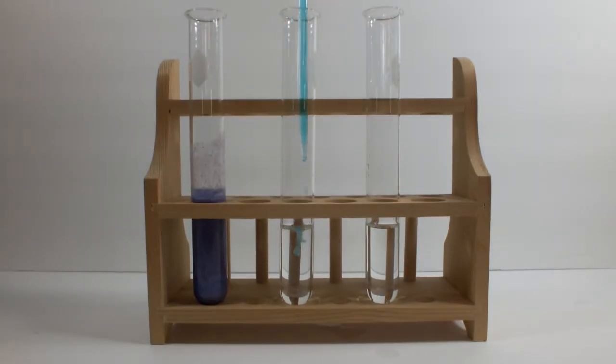Next up is copper 2. This produces a pale blue precipitate. So, I went through quite a bit of careful weighing to make sure I was keeping a nice mole ratio, but you might notice that the cobalt solution is still a little pink, and this copper solution stays a bit blue. Hmm. I sense some trouble.